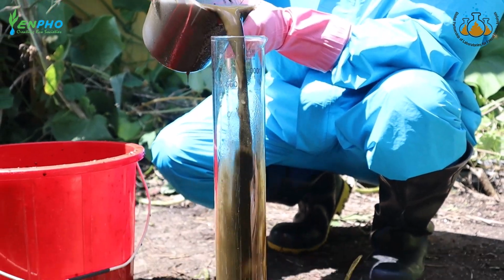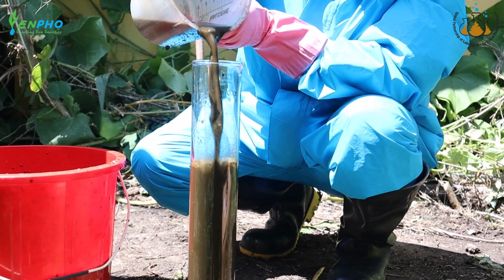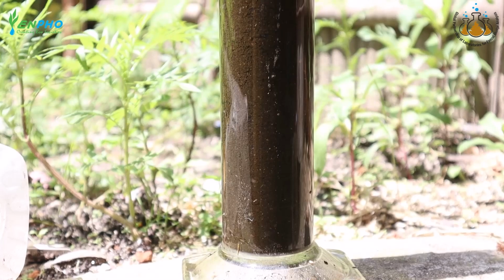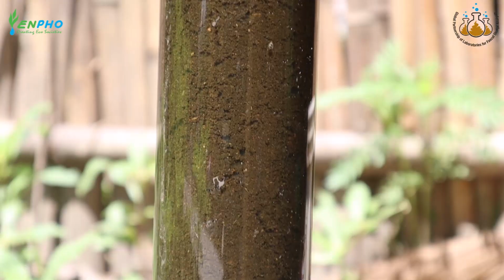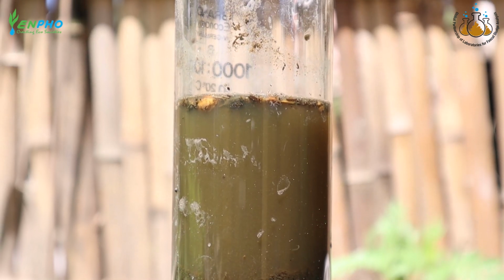The researcher also fills fecal sludge in a transparent measuring cylinder and allows it to settle in order to determine the type of fecal sludge. The type of fecal sludge is determined by observing the settled volume in the measuring cylinder, and it is determined to be semi-solid, and the color is noted to be dark brown.